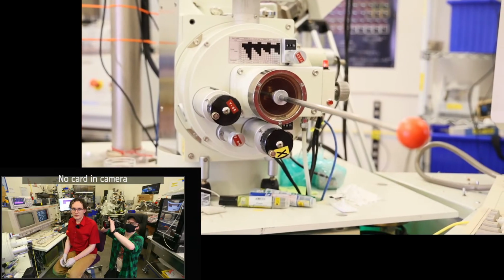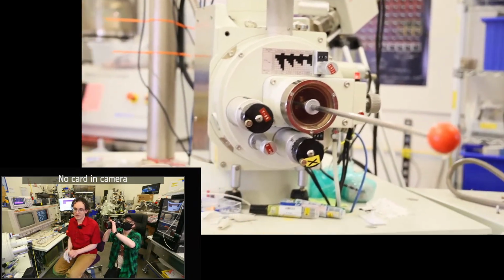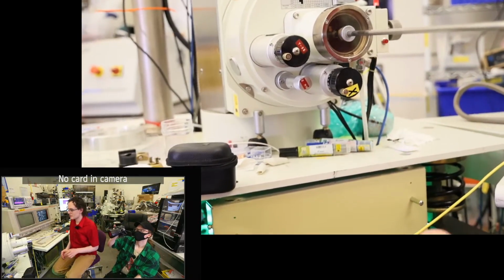It is relatively common to have the turbo pump directly under the stage. That is, you have, Map Labs, you have correctly identified the potential challenges with that design though.